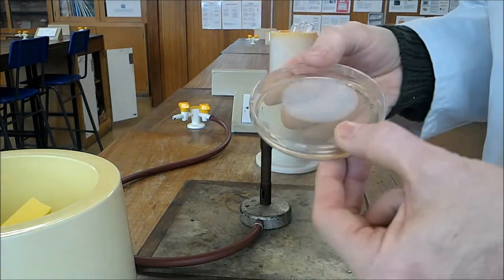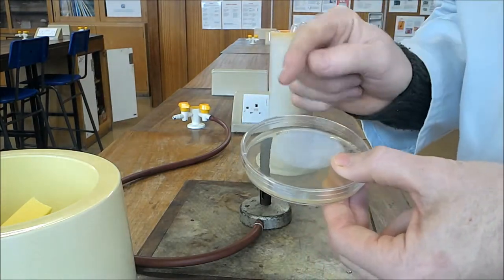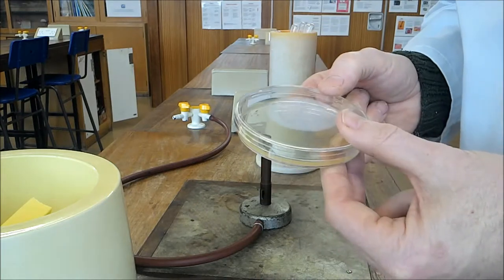Then we need to tape up the sides, and then incubate this overnight at 37 degrees centigrade.